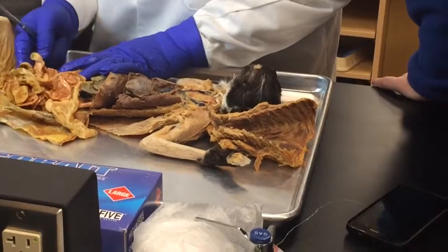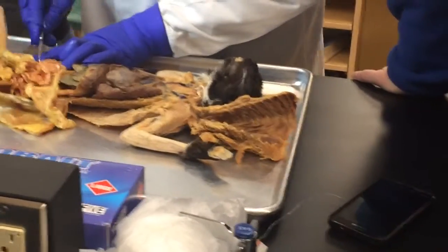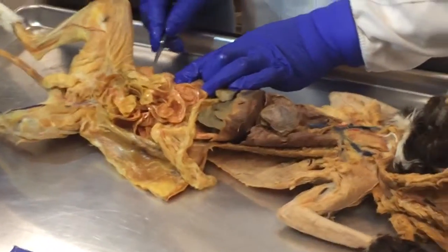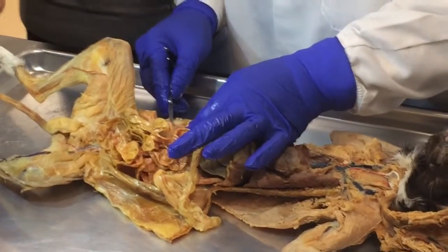Can't you tell? Look, this is the small intestine, this is the ileum. The end of the ileum is right there, right? You see, this is the ceca, and the ceca here is this little tube. The appendix would have been here if it was a human. So you see how the colon is much bigger.